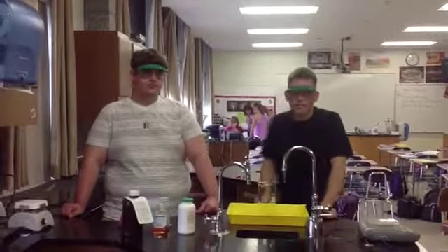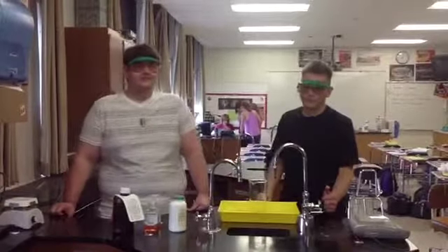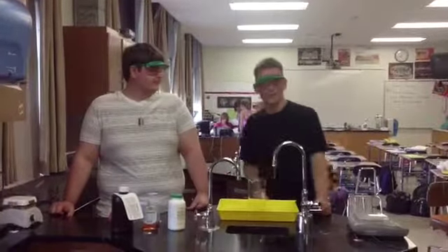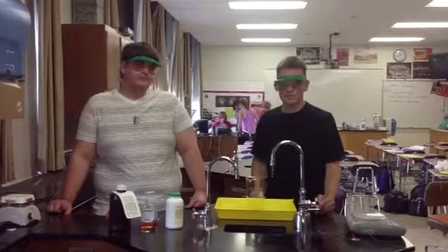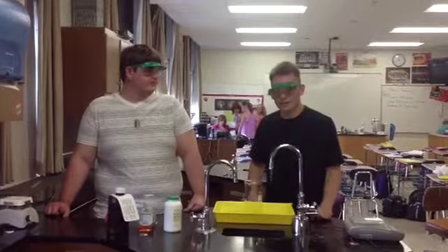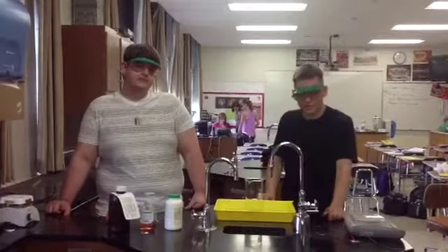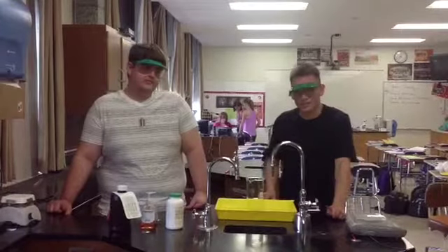Hello there world, I'm Connor, this is Zach, and welcome to the fun world of chemistry. We are going to be going over some interesting things today, specifically chemical reactions, a way that particles and atoms try to get to the most stable possible state. We have a very interesting reaction for you today known as elephant toothpaste.